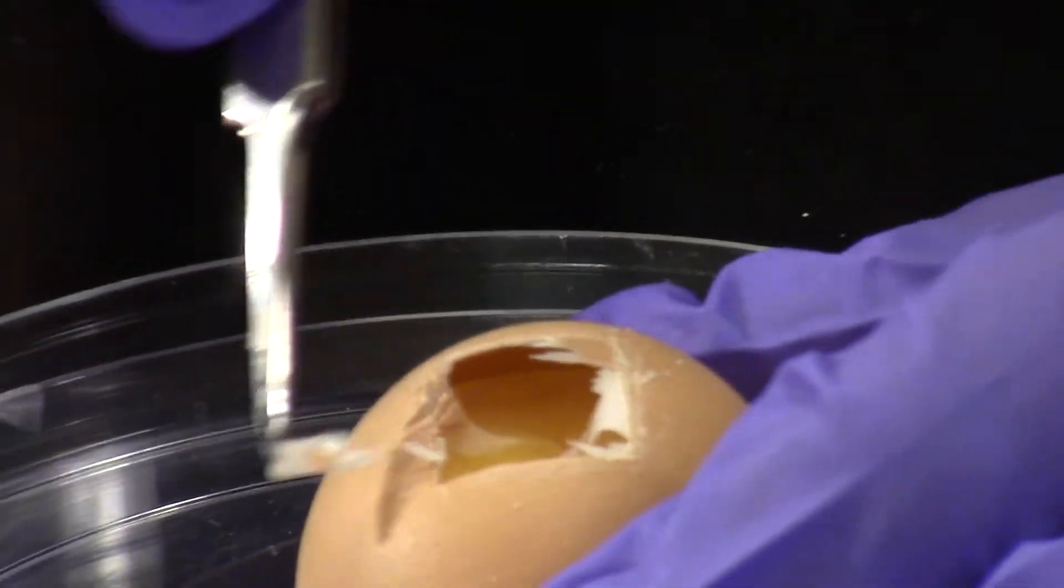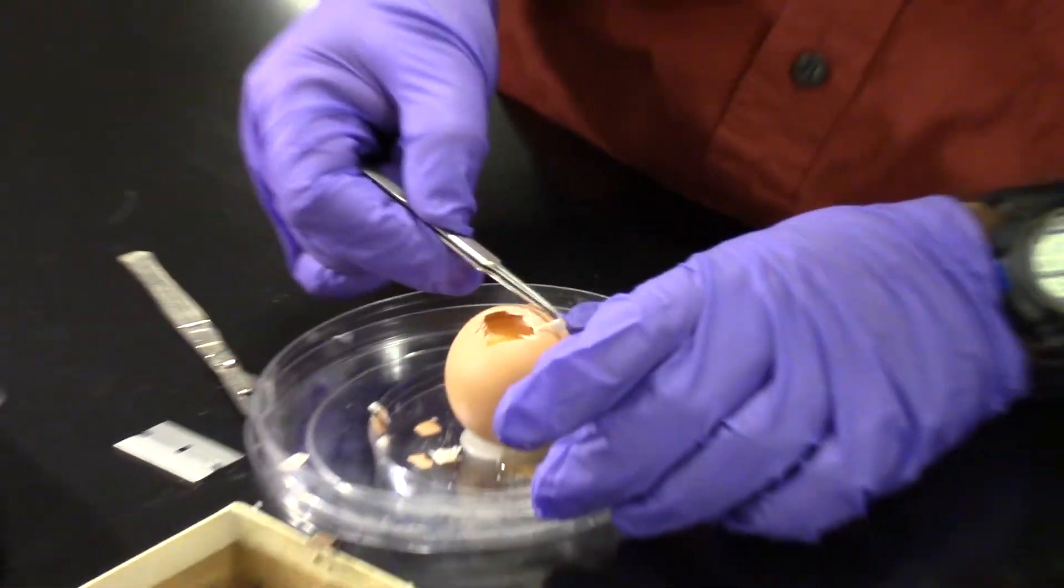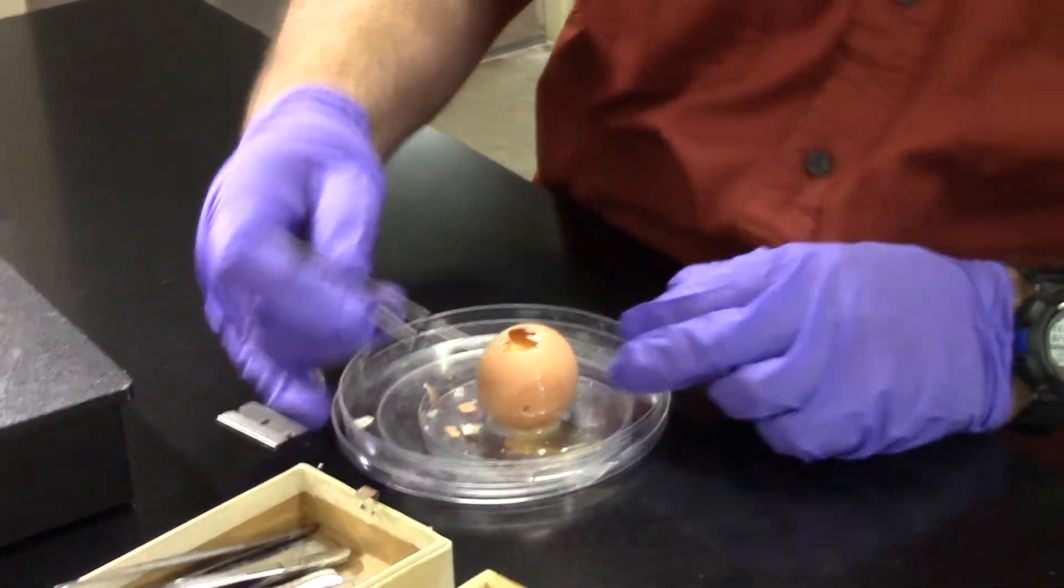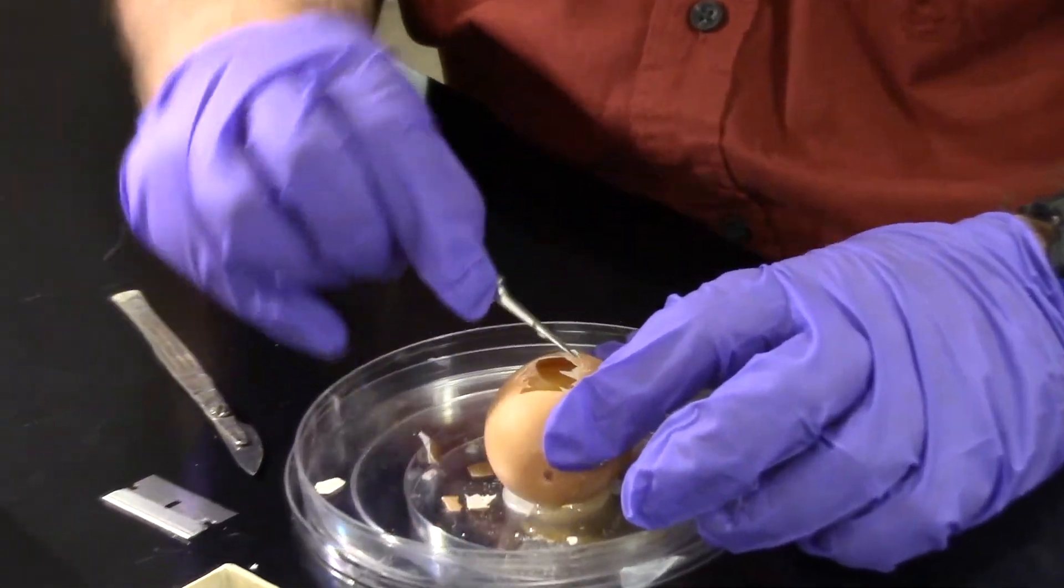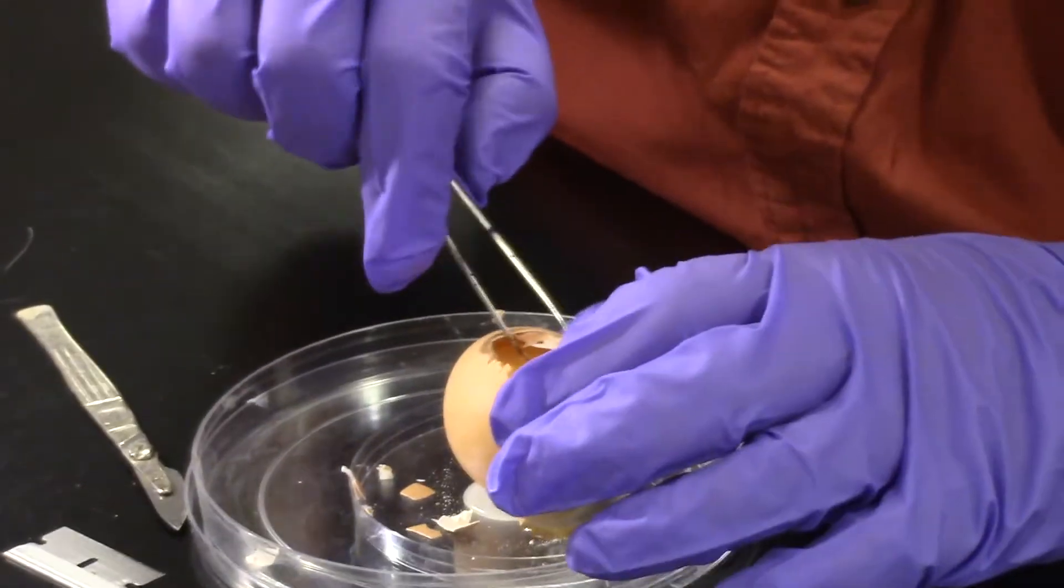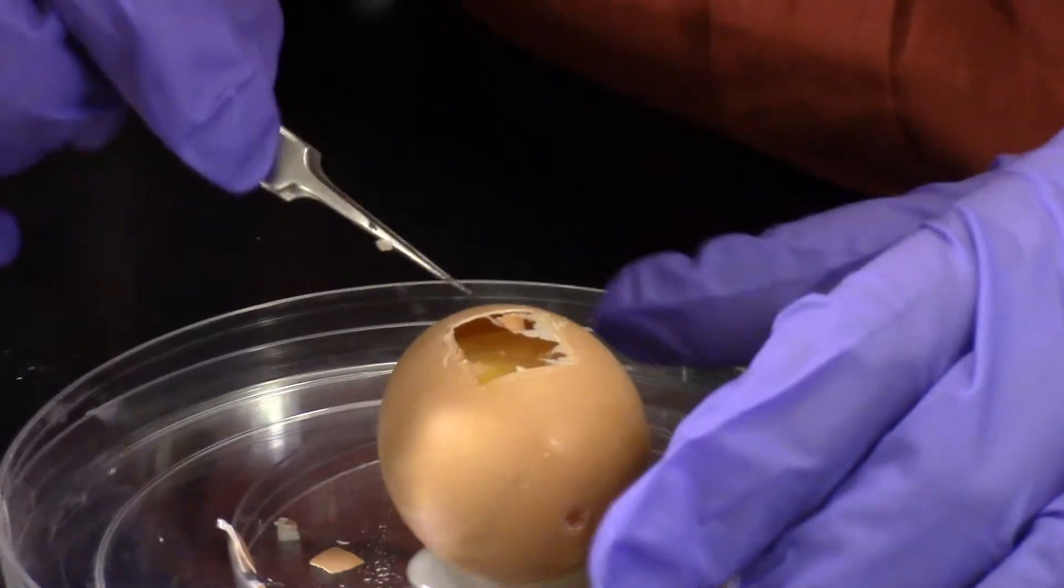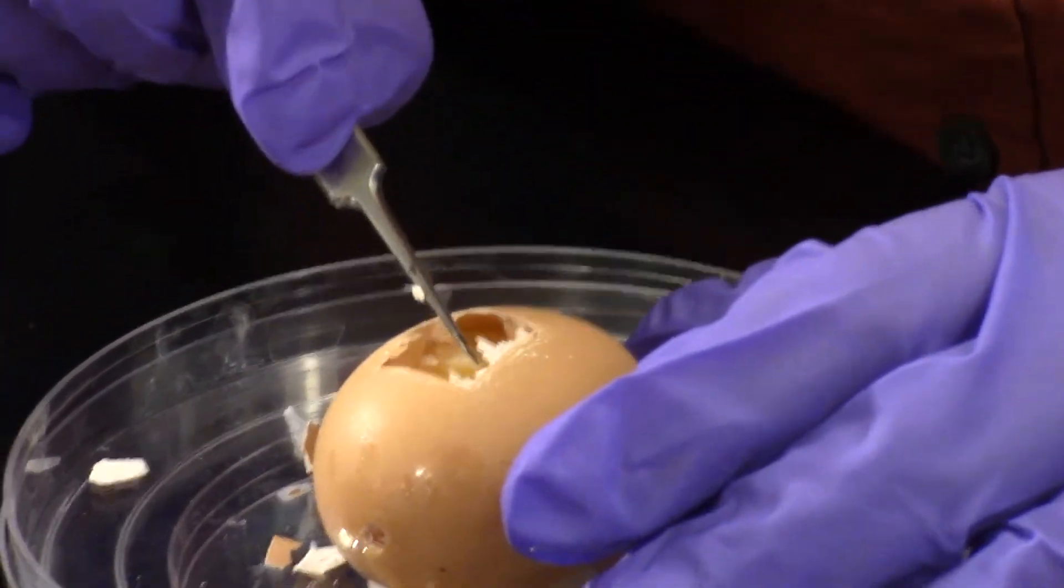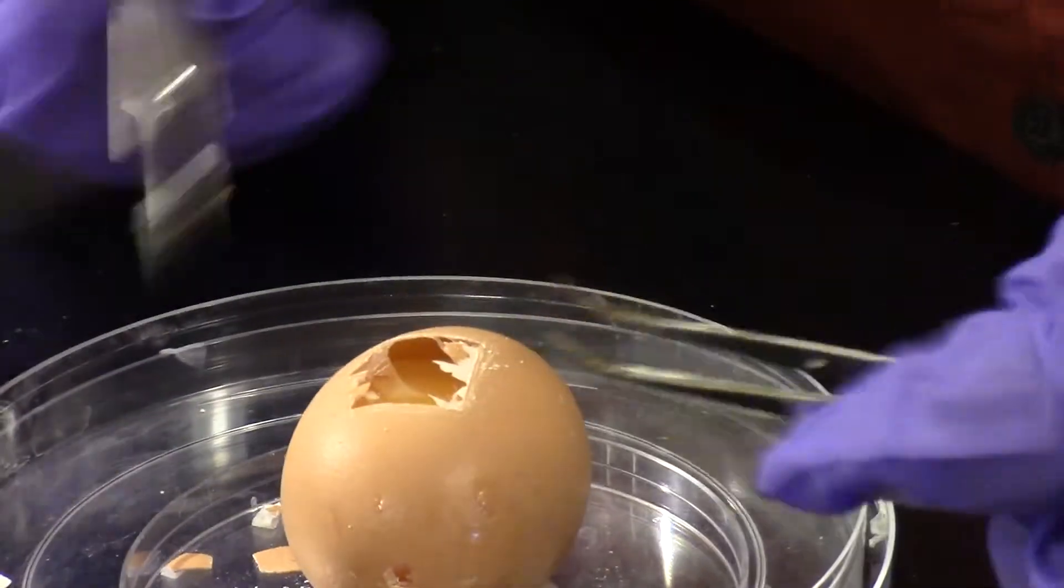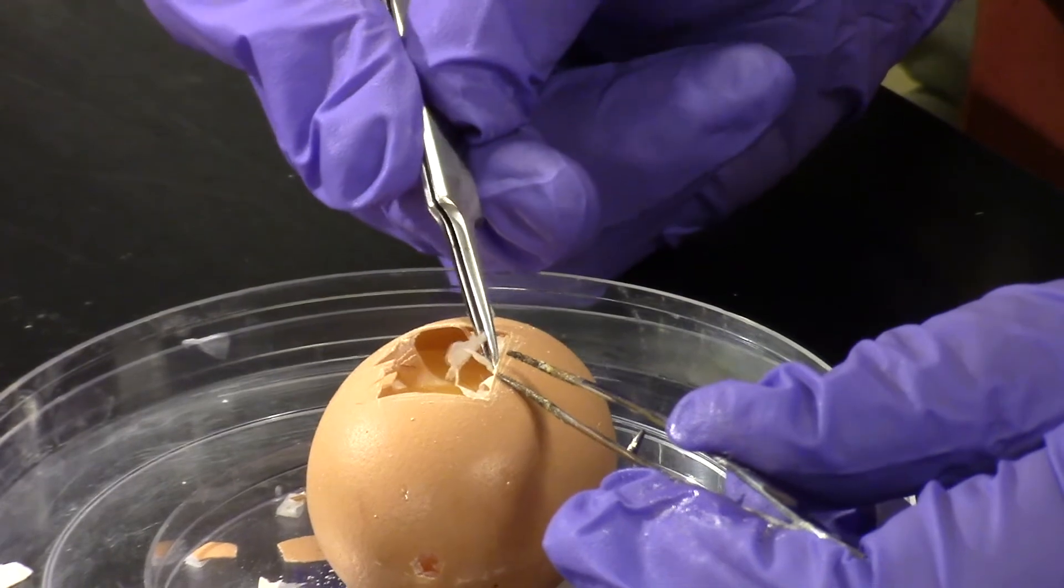I'll try to get as much of the membrane out of the way as possible. Notice that my embryo has started to leak down here at the end. So I'm losing a little bit more fluid than I would like. I only want it to pop the air sac. Looks like either I went too deep or I was too vigorous in my sawing of the egg. So this one I likely, unfortunately would not survive were I to put it back into the incubator. I just want to remove a little bit more of the membrane. And then I'll have you come look straight down in on it.